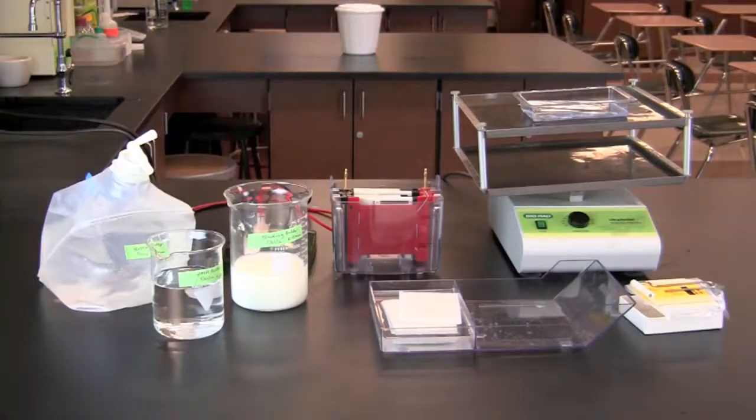In this video you will learn how to perform a western blot. A western blot can be used to identify specific proteins in a sample and provide information about the protein size and relative abundance in the sample.